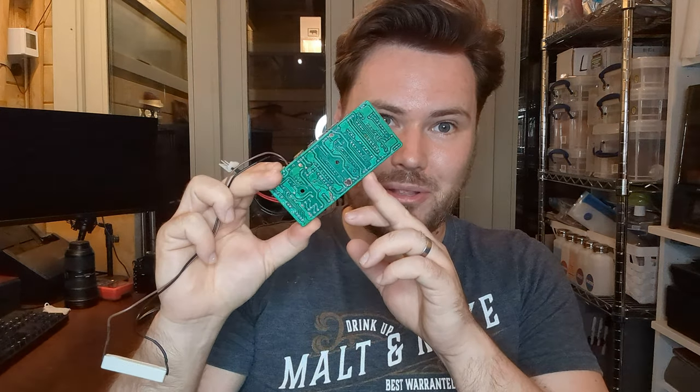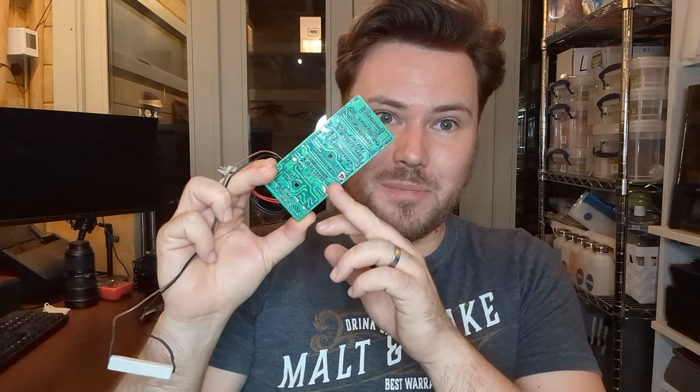Now, I do have to do one thing before I put it back together fully, and that is sort out this bare copper that's exposed on the bottom. Some of those bits of the PCB came off while I was cleaning it, and the right thing to do is cover it up with something non-conductive. You could use Kapton tape, but seeing as I've got it apart, I'm going to put some nail polish on there, just to make sure that it doesn't short out against the aluminium case that's somewhere on the desk here.